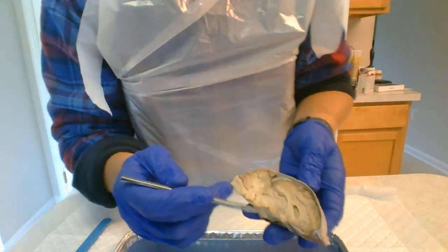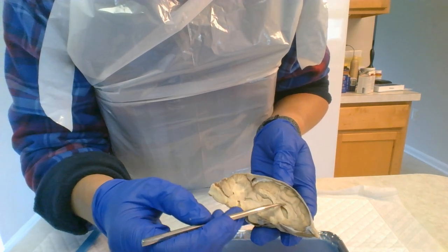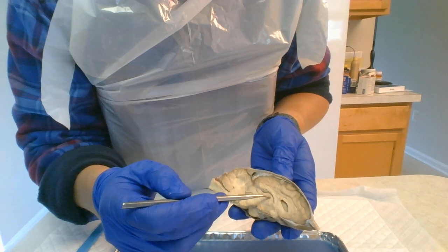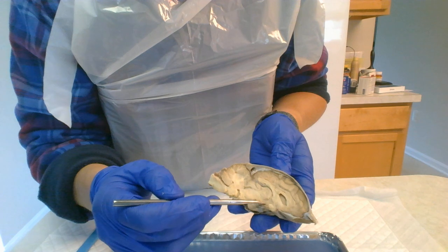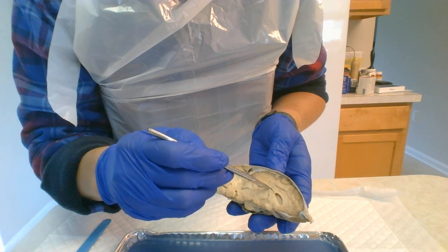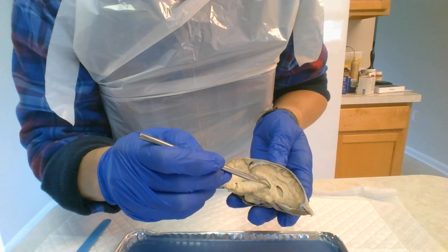Next, in the mid-sagittal section, we have the corpus callosum, which connects the two hemispheres together before I dissected it. Then you have the thalamus and the hypothalamus below it. Then you have the lateral ventricle with a small opening here, and the septum pellucidum here.